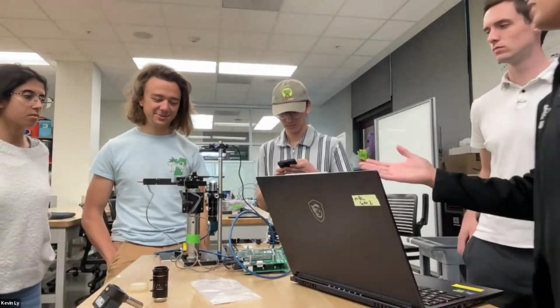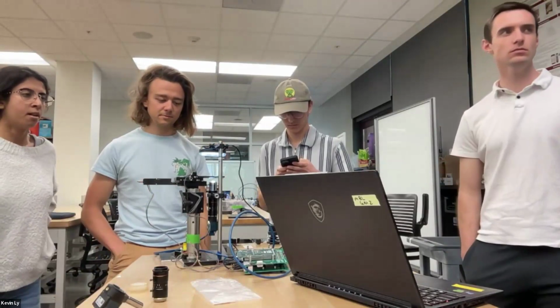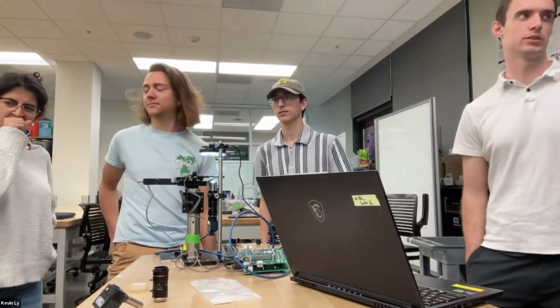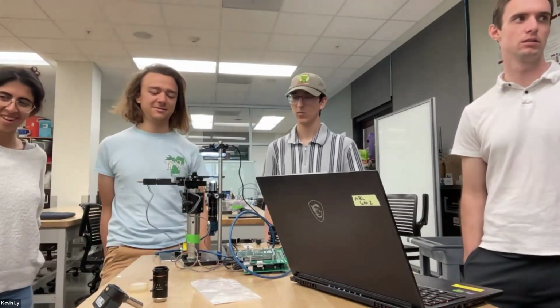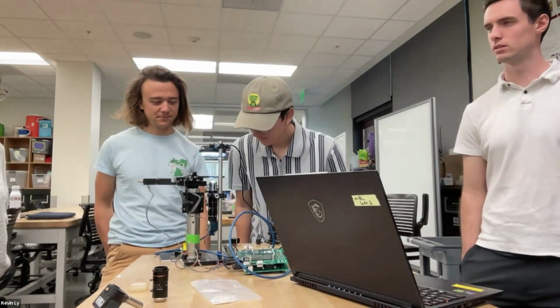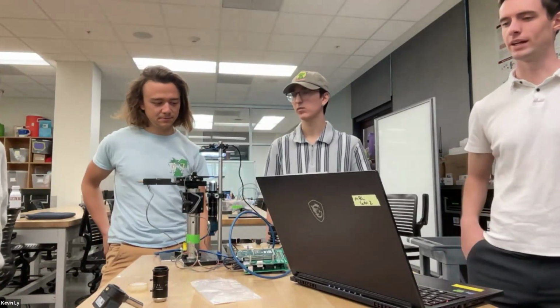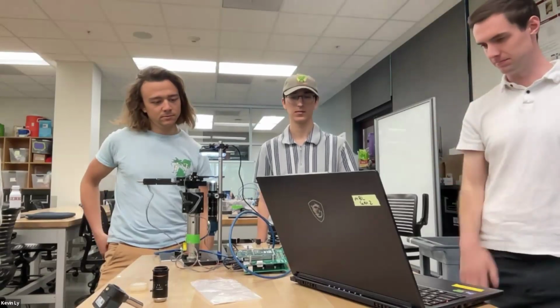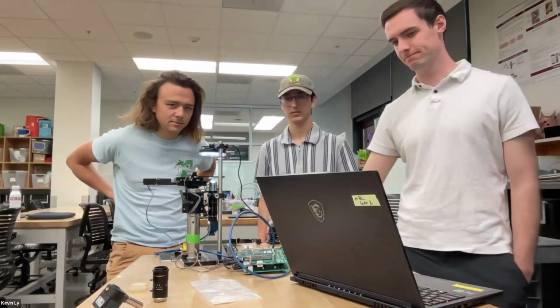Yeah, so you could move the light source, but you'd only be able to study the surface of it. Oh, I see. Yeah, I think you would need to maybe move the light source over from the bottom. Or you can take a tissue sample of it off the top and then use that on the slide. Yeah, exactly. This is really cool.